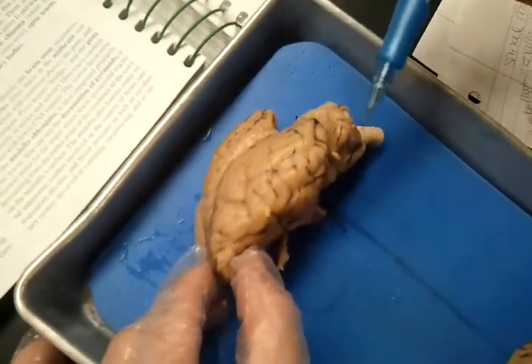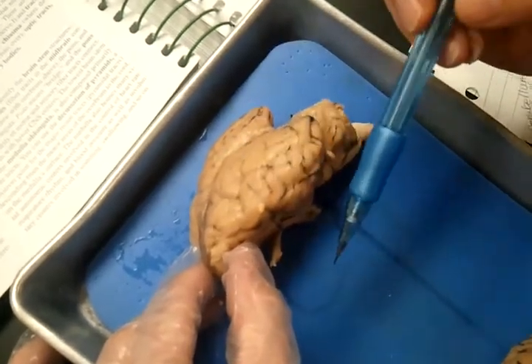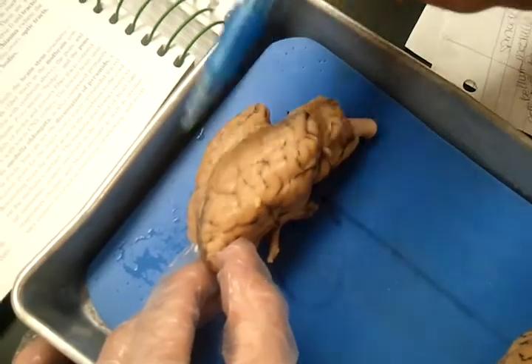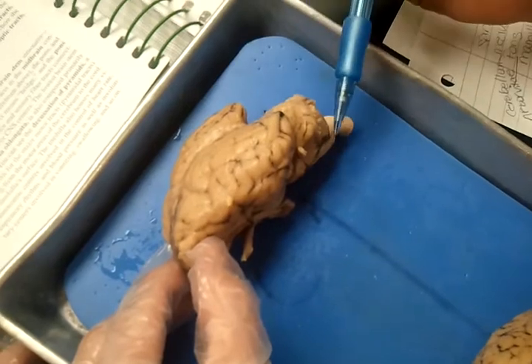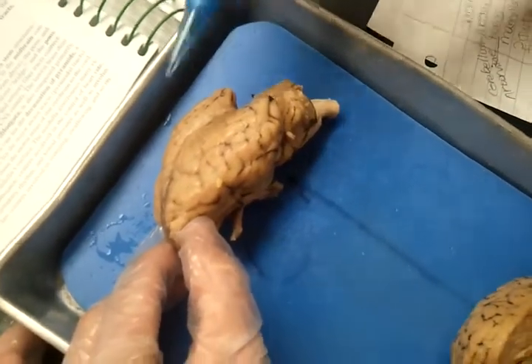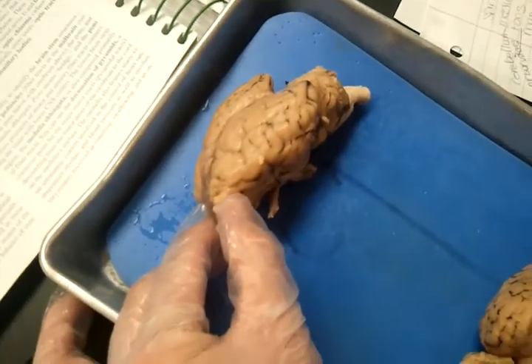So to sum up, this whole area in the front is actually a motor area. This deals with all of our involuntary and voluntary motor skills. Then we also have back here our sensory areas. So that is two areas right there that just kind of sums up the functions in the brain.